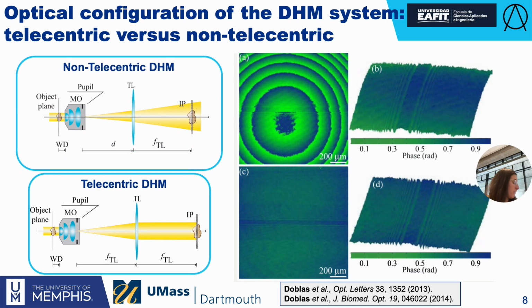So what is that problem? It is what I'm pointing out here: you have your sample, and immediately your sample is within a plane wave, but the same sample information also overlaps with the spherical wavefront introduced by the non-telecentric configuration. So you really need to compensate for it computationally. Otherwise, with small differences, you get this kind of curved reconstructed phase image, so you are not able to have exactly the same value of the phase independently of the position.